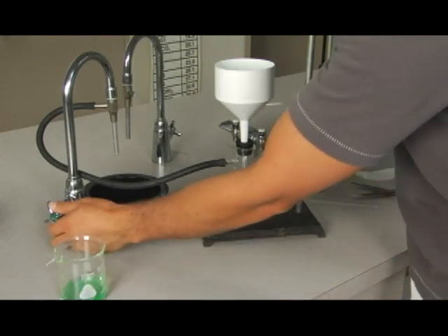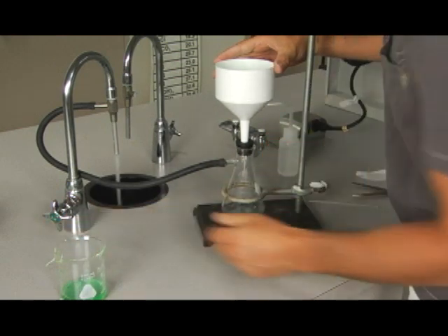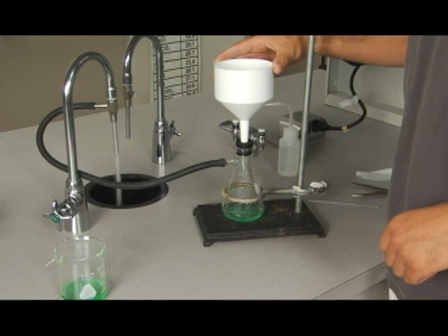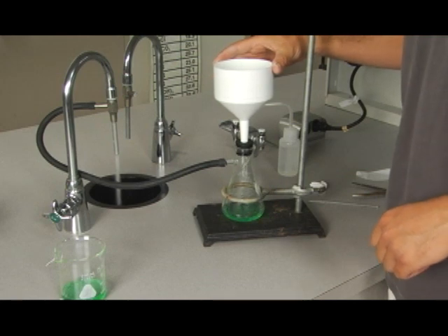When I turn on the sink, the fluid flows freely. And our solution is filtered in seconds instead of minutes.